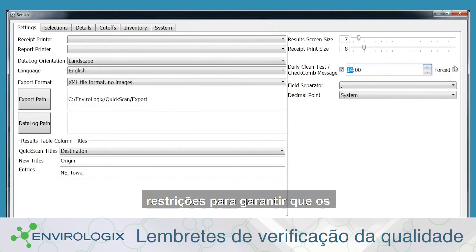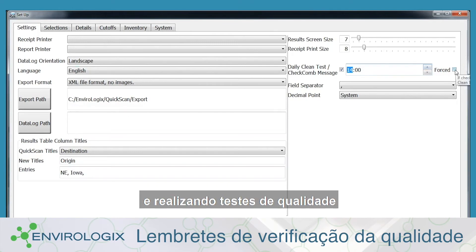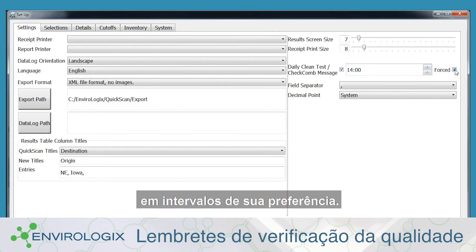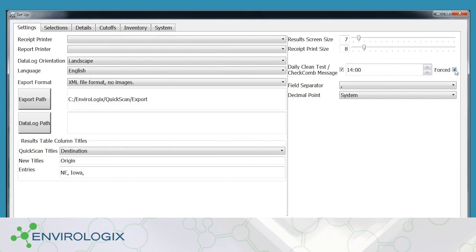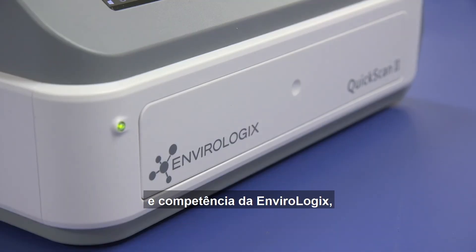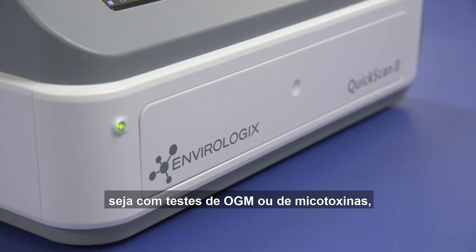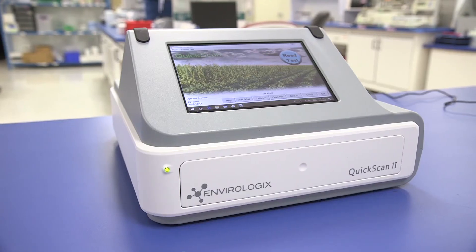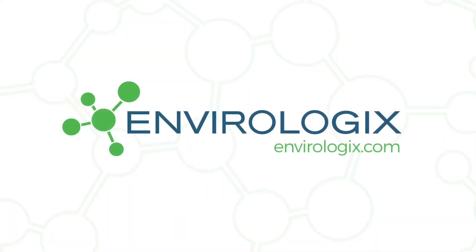Reminders or restrictions ensure that your operators are calibrating and running quality checks at intervals you choose. Leverage the experience and expertise of Envirologix, whether testing for GMOs or mycotoxins, and discover the advantages of QuickScan 2.